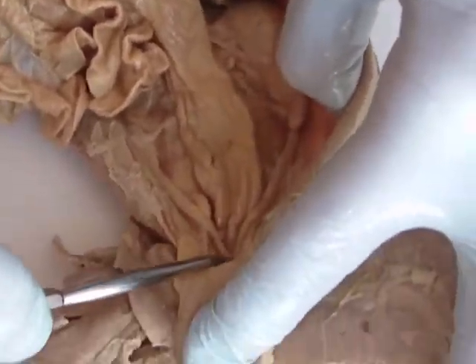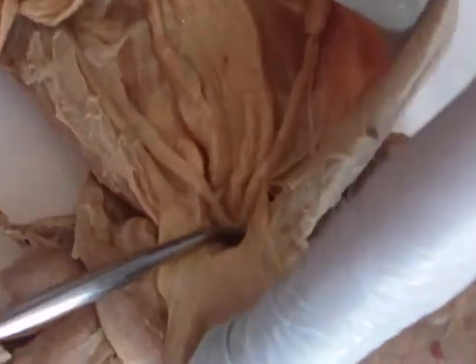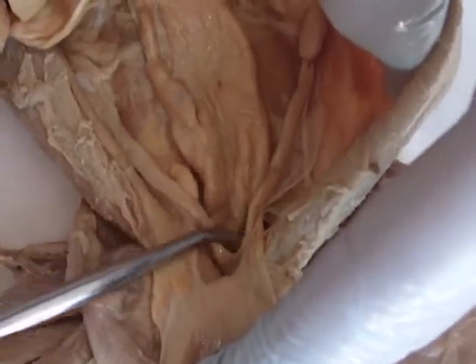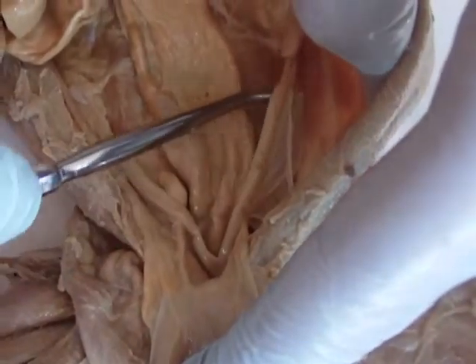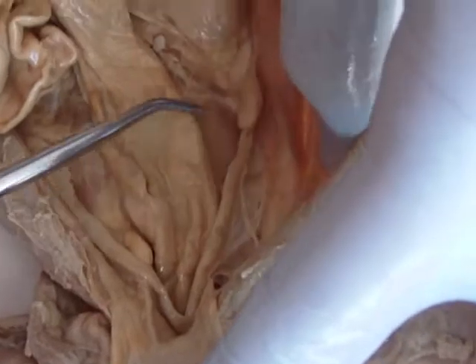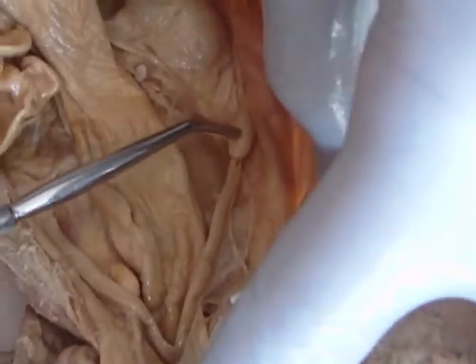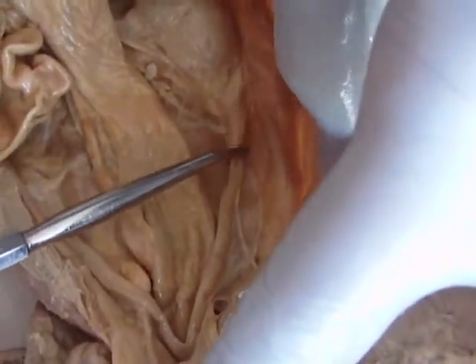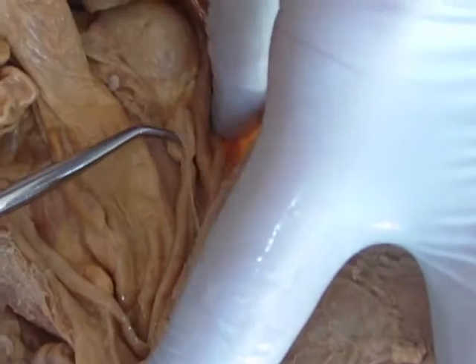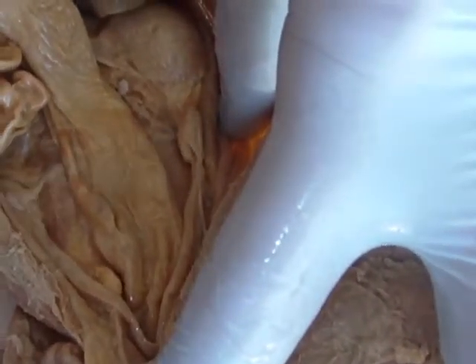Right underneath here you have your uterus, right underneath the bladder. The tubes coming up from the uterus are your uterine horns. That little pine-nut-looking thing right there is your ovary, and the tissue covering that ovary is the fallopian tube.